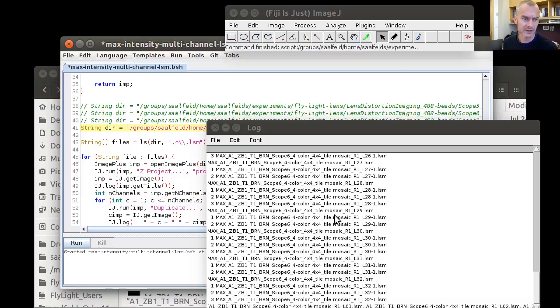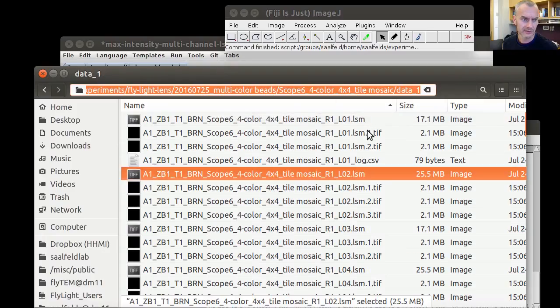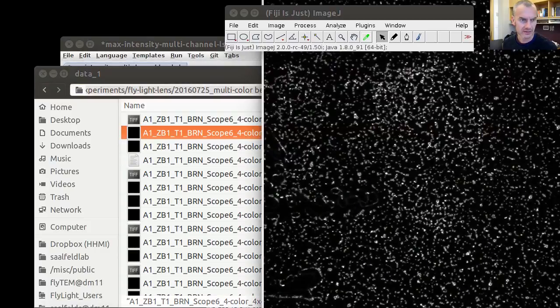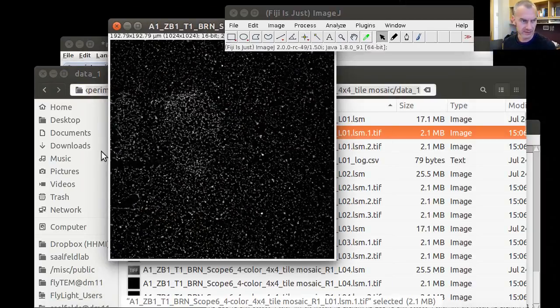After the script has finished, we should see a lot of additional files in this directory. As we've seen before, they are named by the original file name and then the individual channel projections. This is one example. So now we see that more or less all beads are in the focal plane, which is approximately the place where it's brightest, so the max intensity projection does an okay job here.